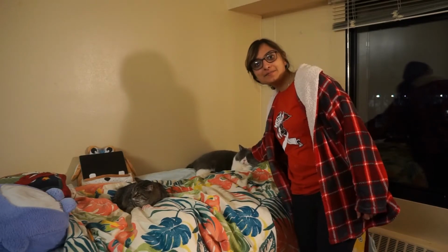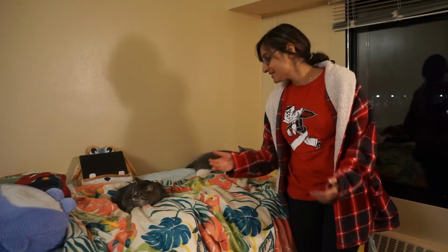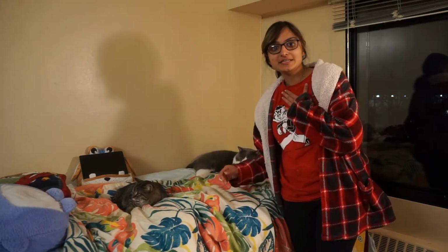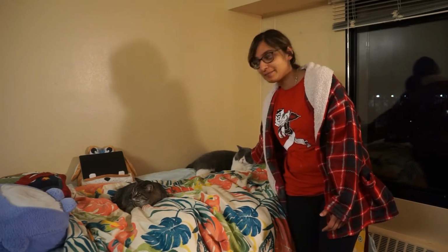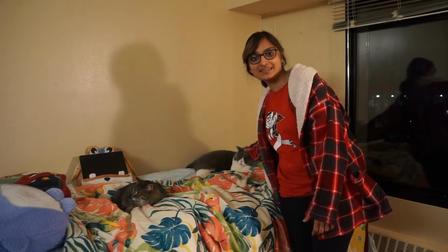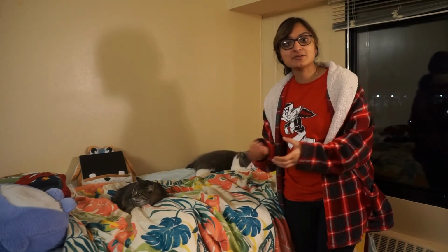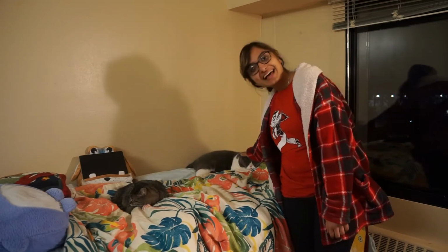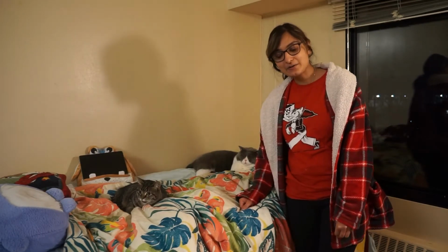Today, I want to talk to you about our DNA basically, and how we have different genes, but how there's some similarities between our human genes and these cute little cats and their genes. The genetic diversity, there are a lot of overlaps between us. And as you'll find out, the cats from my example this time, actually it was so random. I just selected 59 random genes with their IDs, and I tried mapping them to genes in various organisms, beginning with cats, then their favorite treat, which are mice, and lastly the cows.